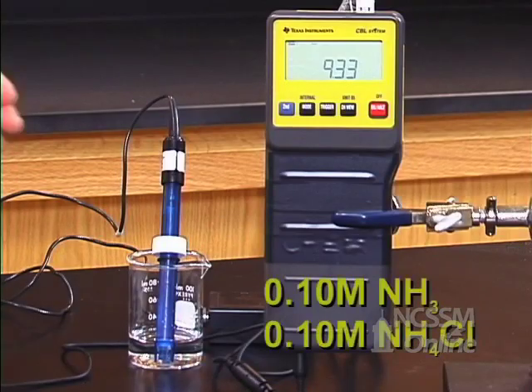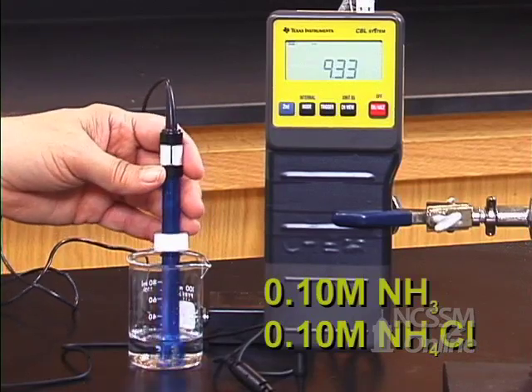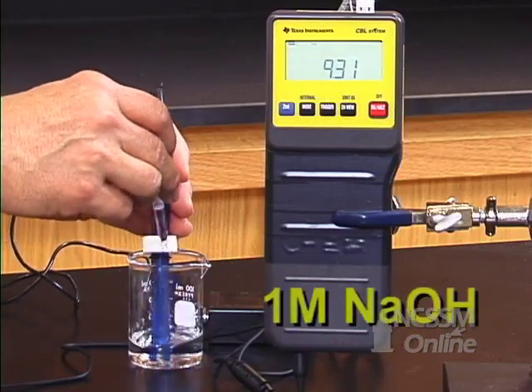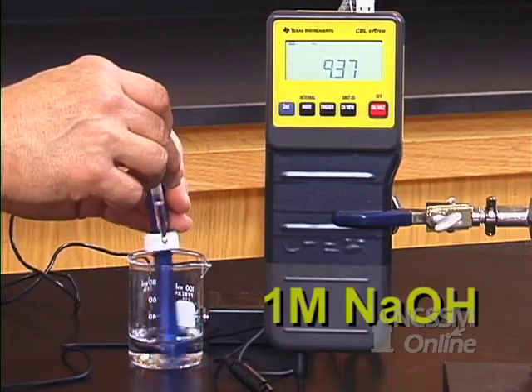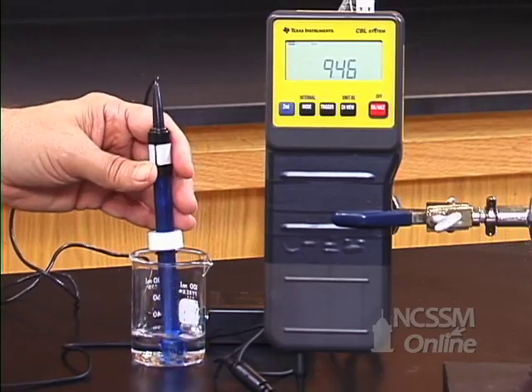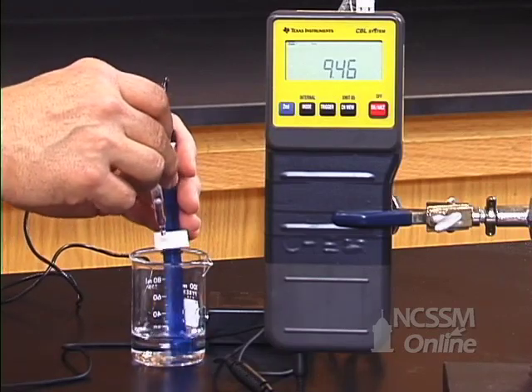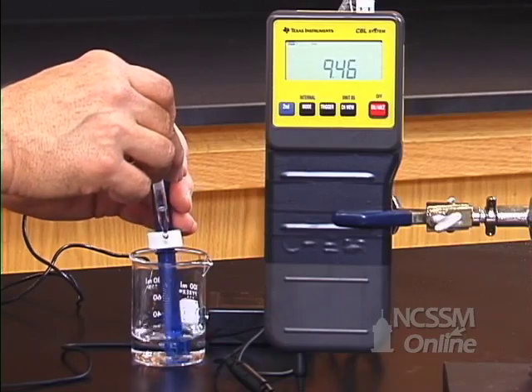We have a new sample of the 0.1 molar ammonia, 0.1 molar ammonium chloride buffer solution. We're going to add some 1 molar sodium hydroxide to the solution. We add 5 drops — the pH has only risen slightly. We're using up the conjugate acid.